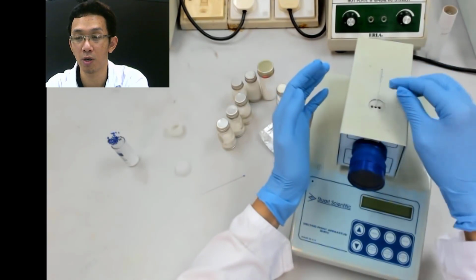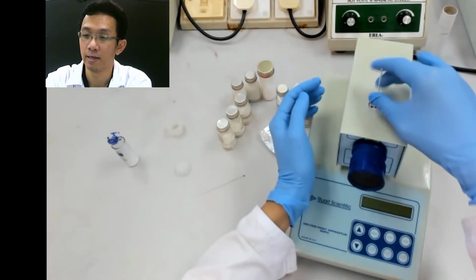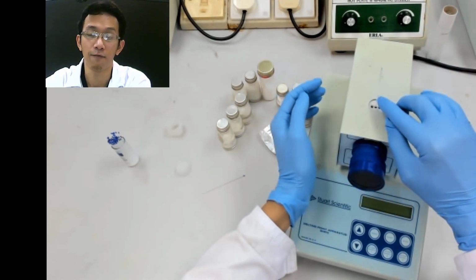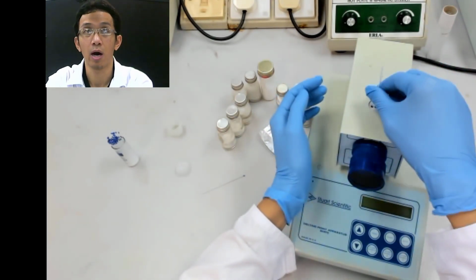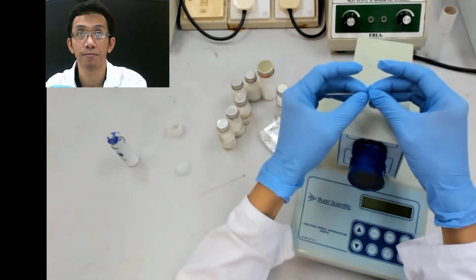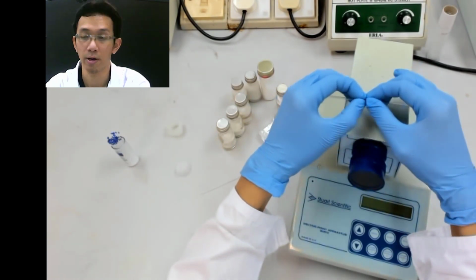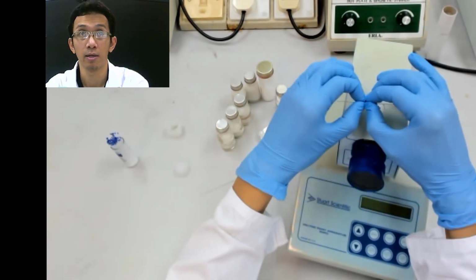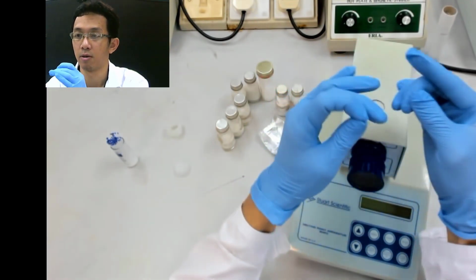So you need to make sure, in order to break this capillary tube, that there is some left over, so that you can take it out later on. So how to break that? Simply go to the middle there. This you put in your lab report. So you just go to the middle, and you just break like that.